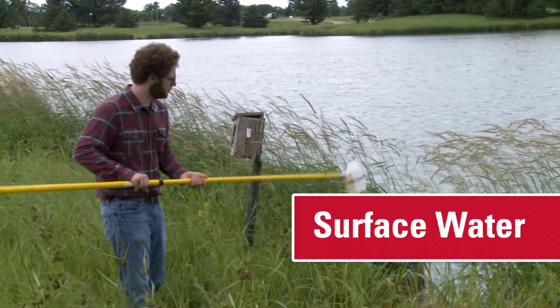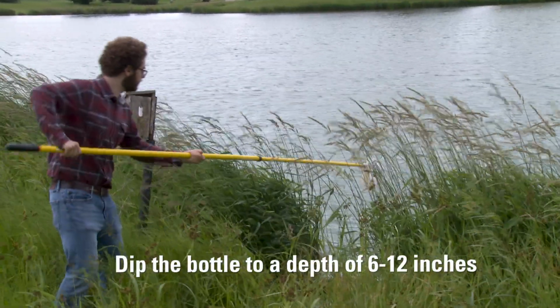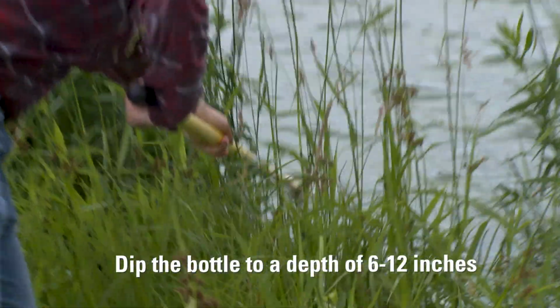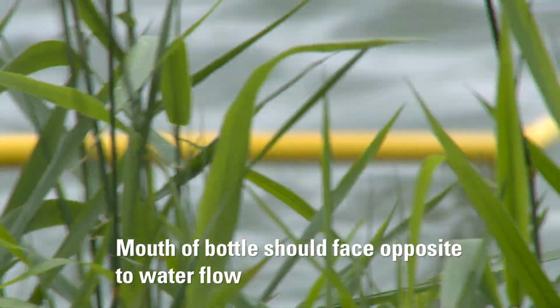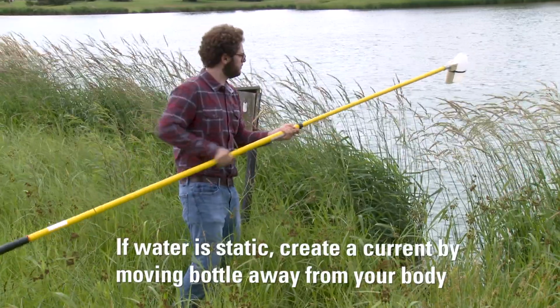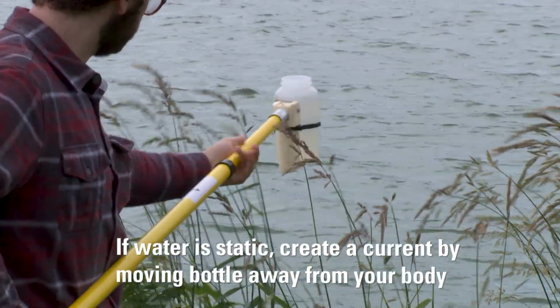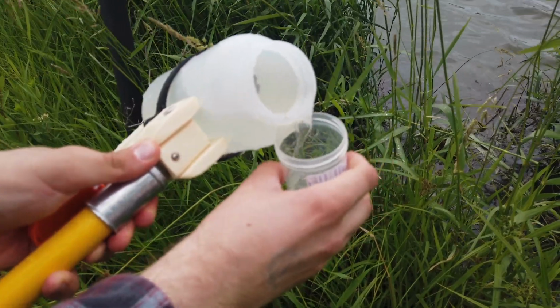For surface water, a sampling aid such as a sampling stick may be used. Dip the sample bottle up to a depth of 6 to 12 inches. The mouth of the bottle should face opposite to water flow. If water is static, create a current by moving the sample bottle horizontally away from your body. Then move the top of the bottle slightly upward to allow air to exit.